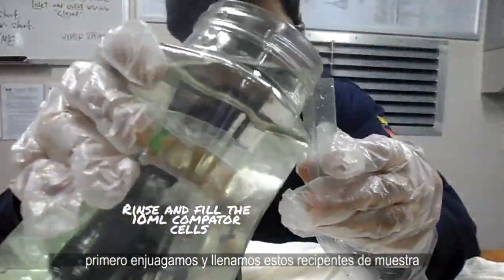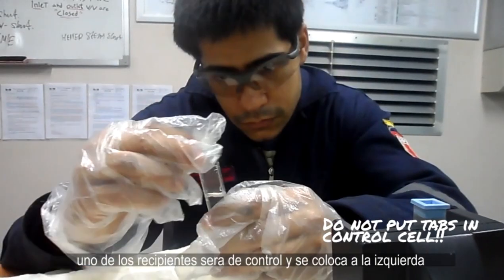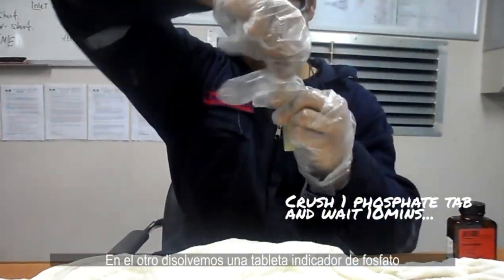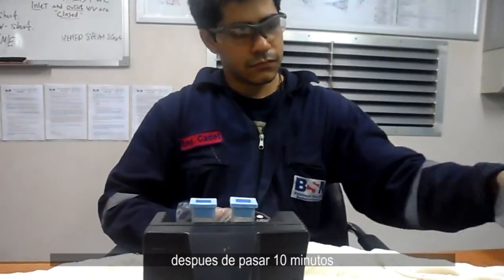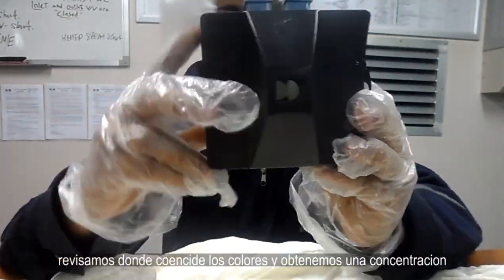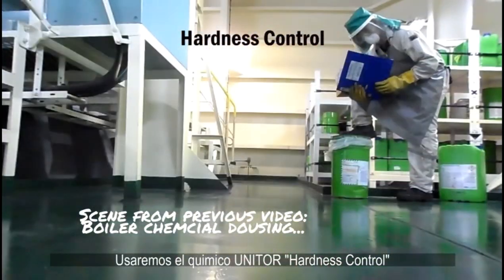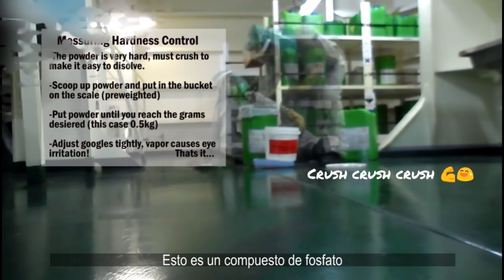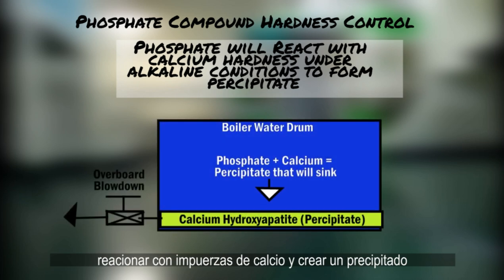To test phosphate, we use a comparator. Rinse and fill two sample cells with 10 milliliters of sample water — one is the control cell on the left side of the comparator. In the other cell, crush a phosphate indicator tablet, shake to dissolve, and wait 10 minutes. After 10 minutes, use the indicator disc to find where the colors match and obtain the phosphate concentration. To control phosphate, we use Unitor's hardness control — a phosphate compound that reacts with calcium impurities to form a precipitate.